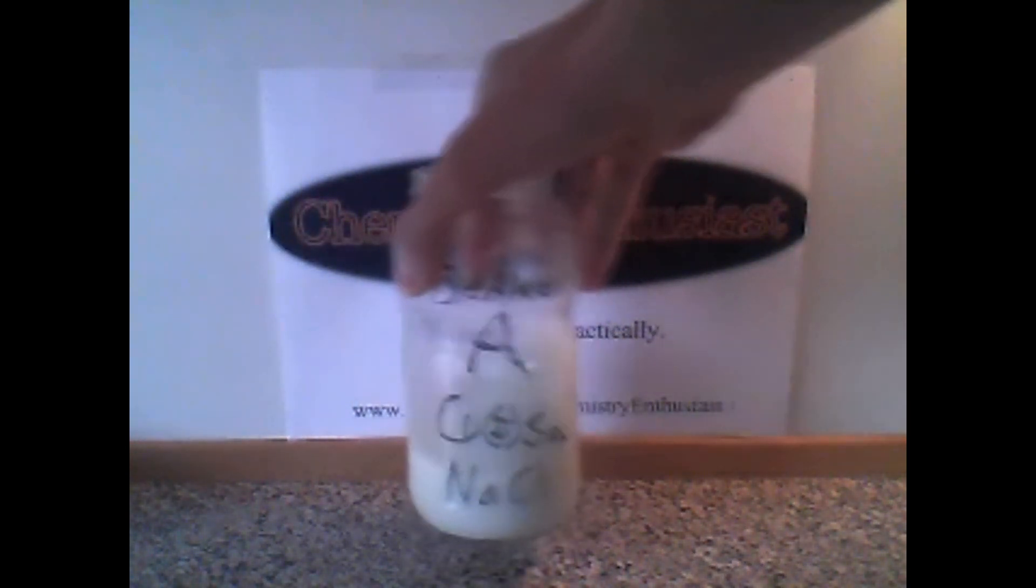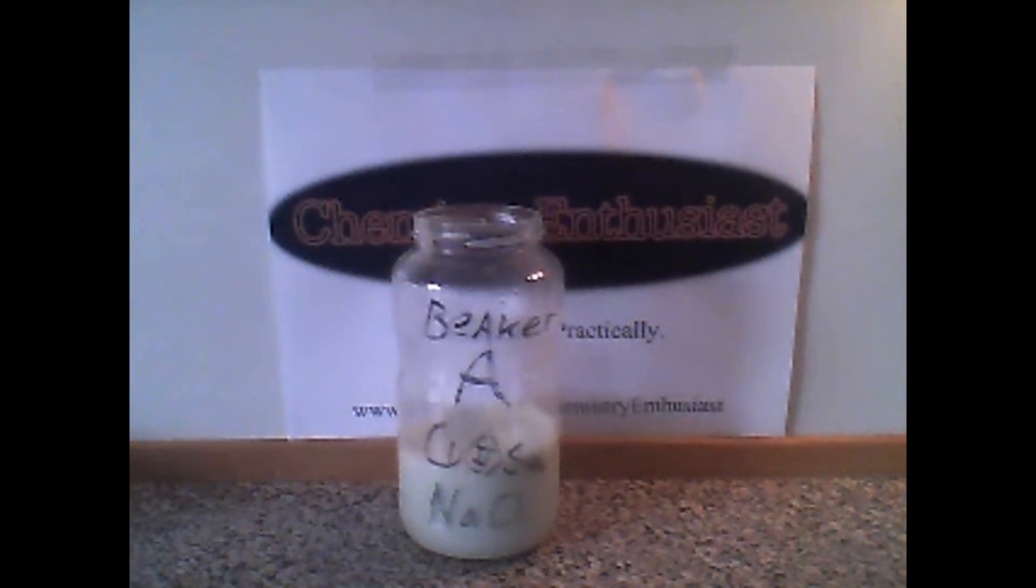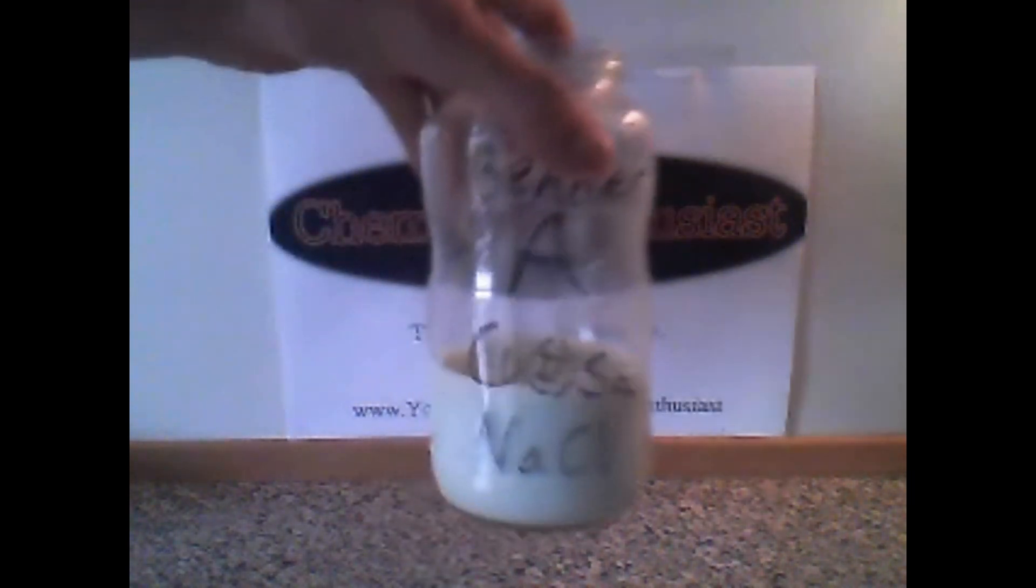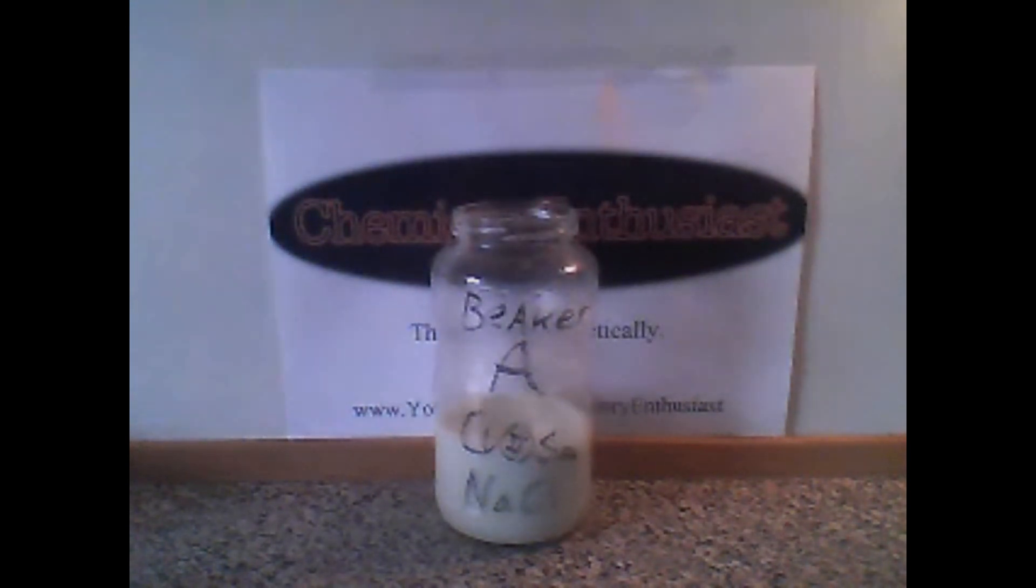Now stir it up well. As you can see, the copper chloride is in water, and you can already see it falling down to the bottom. It happened really quickly. This isn't time lapsed. The chemical is very dense.